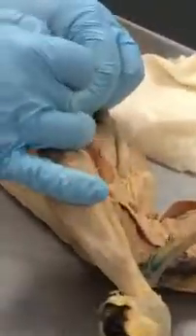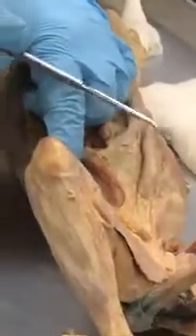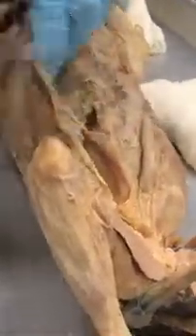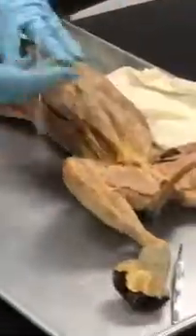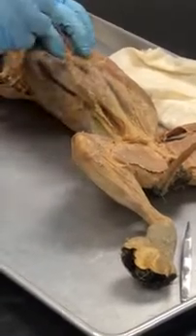The internal obliques, you don't have to worry about on the cat, but I dissected this one out. It's over here, and if you see it closely, you could actually see the fibers going that way, not this way. So that's where that is. And the transverse abdominis is too deep, you can't see it on here. You also see on the cat, there's a muscle that's going to be over here and another one on that side.